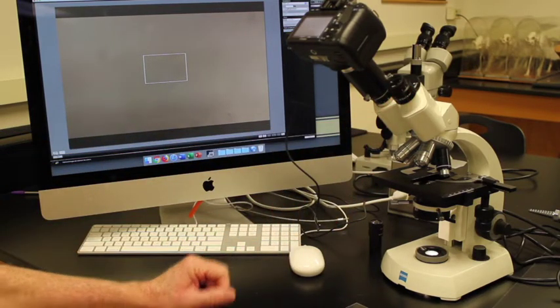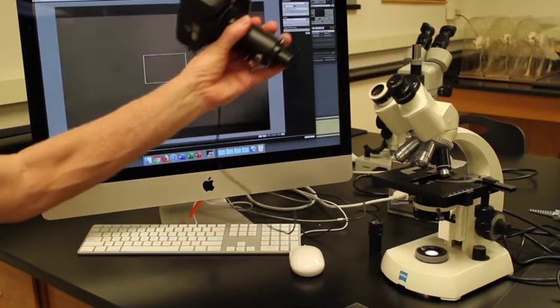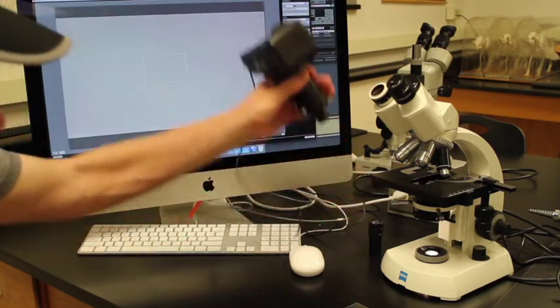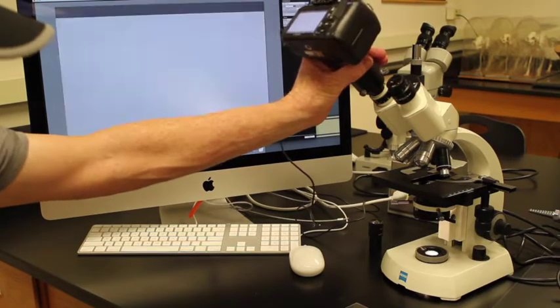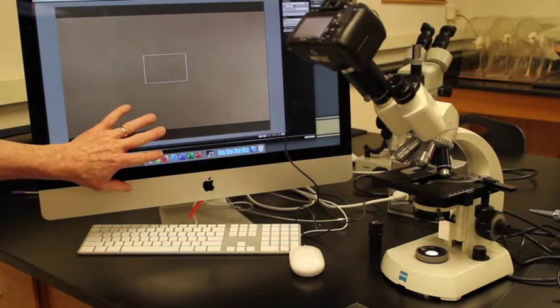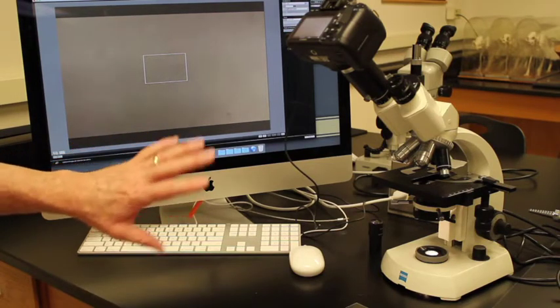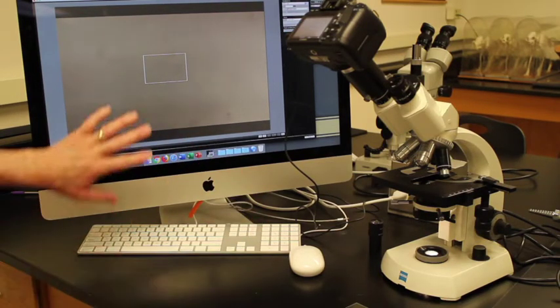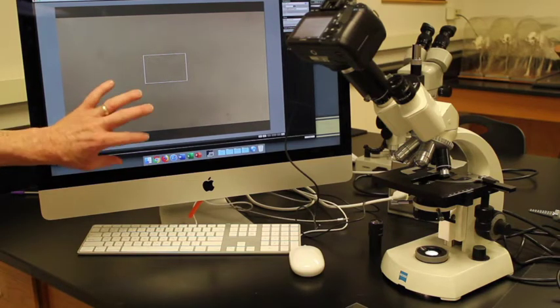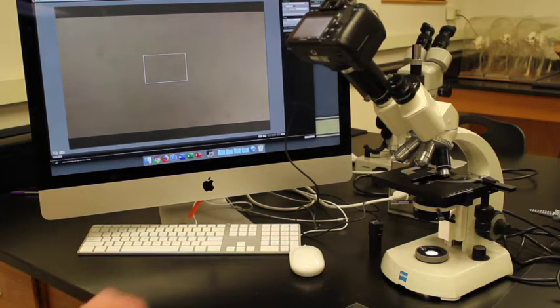We also have a camera attached that goes right into the eyepiece. We basically take this eyepiece out, put this camera in, and we have it hooked up to a computer. We can get a live image on the computer, so everything that I see in the microscope you will see on this computer image.